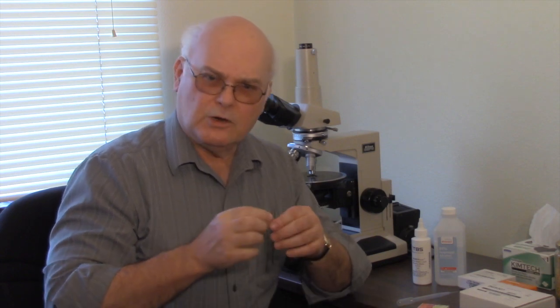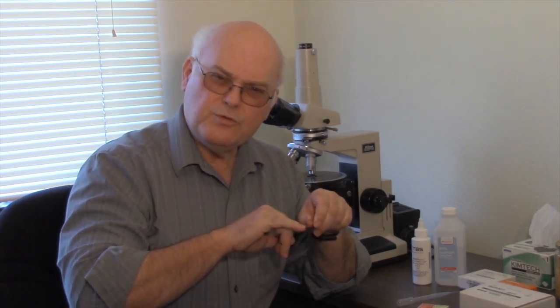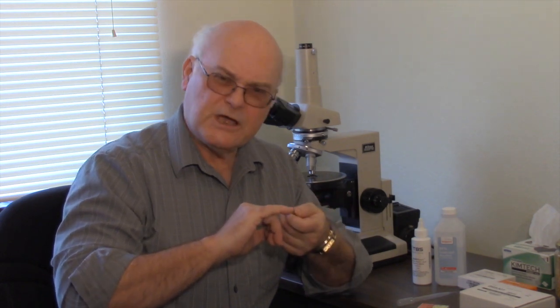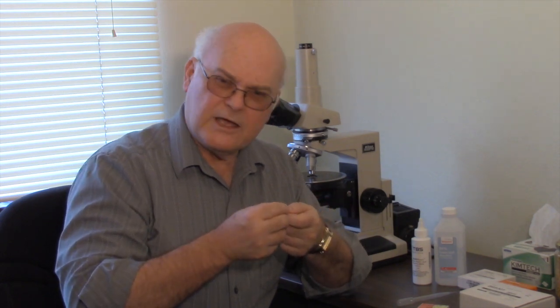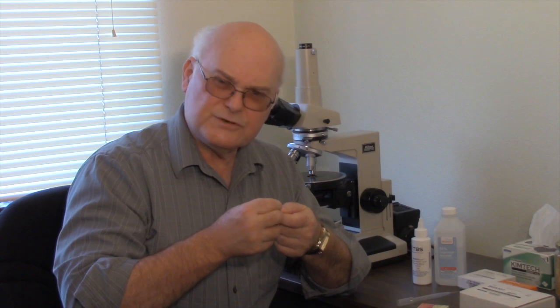Another tool we need is a simple pair of forceps. These forceps are a little different than what you would normally get. One thing you want to look for is that they're smooth on the inside rather than having a rough structure.